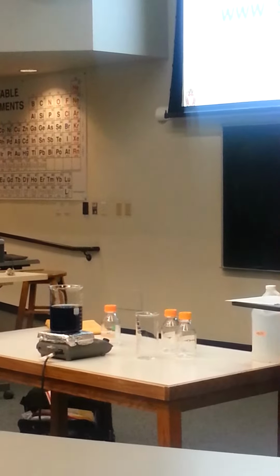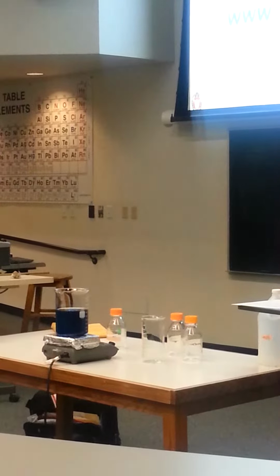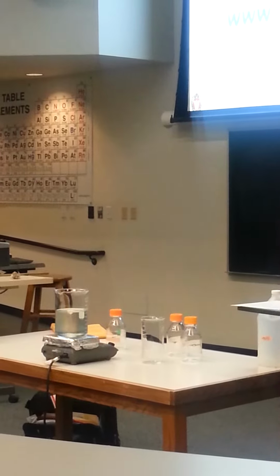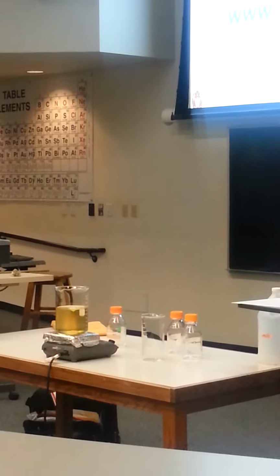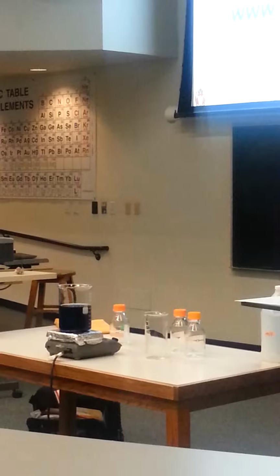Whoa. What? It's going back and forth. What's going on? I don't see what's going on here. Look, the last time I looked at the beaker, it had in it a liquid that was blue in color.